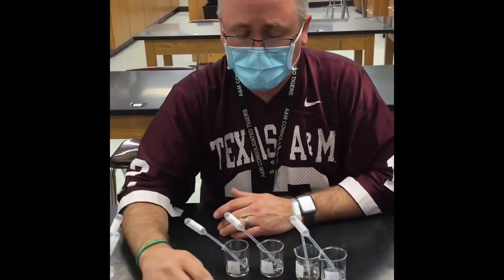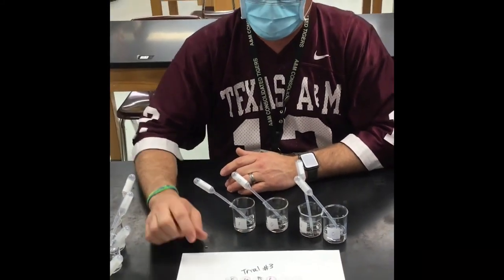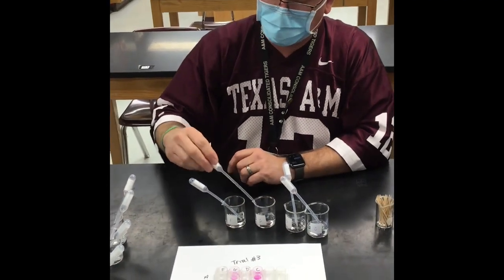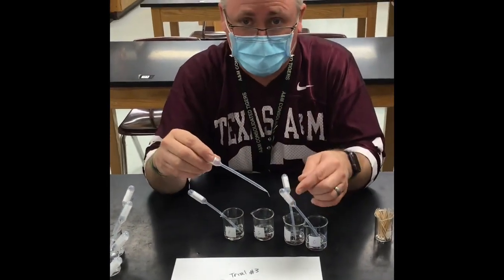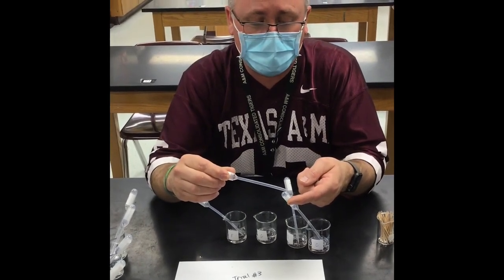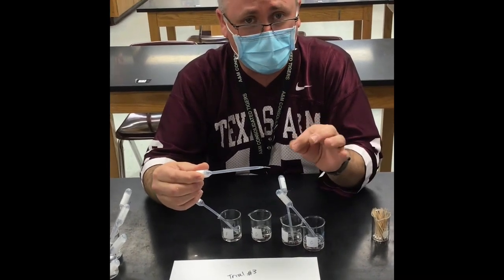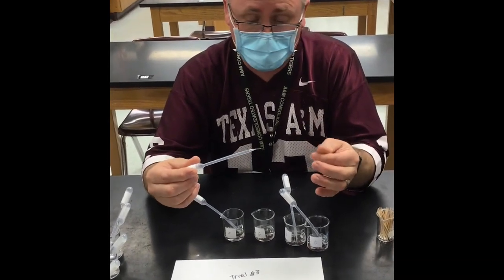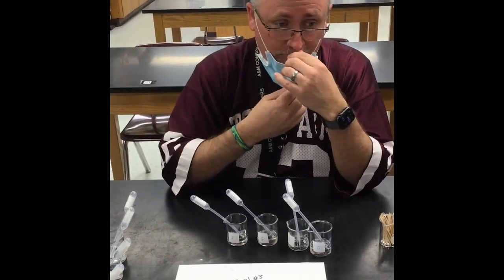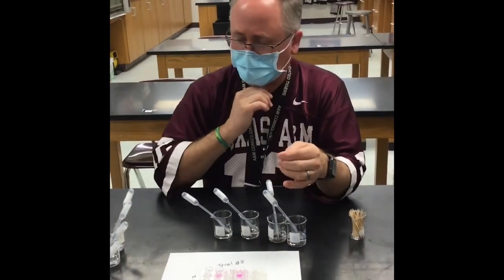So it kind of looks like I'm going to take G and A as they kind of really made that pink solution. Let's do G and A. So G, I'm going to take a little bit of G, and this is not a good idea, but this is really low concentration. To kind of get an idea of which one might be the acid or base, I'm just going to put a little bit on my finger and see if it's slimy or if it has an odor or anything like that. That has a little bit of an odor to it, like a volatile liquid kind of odor.